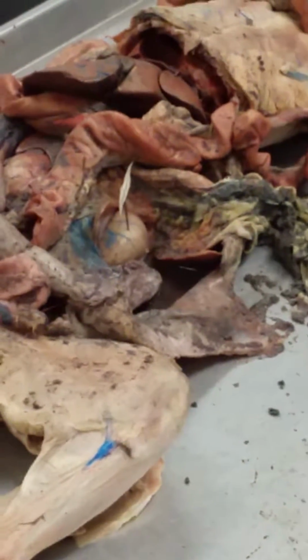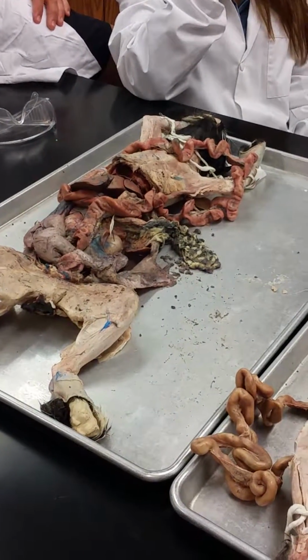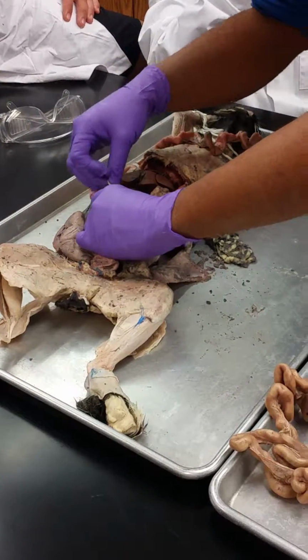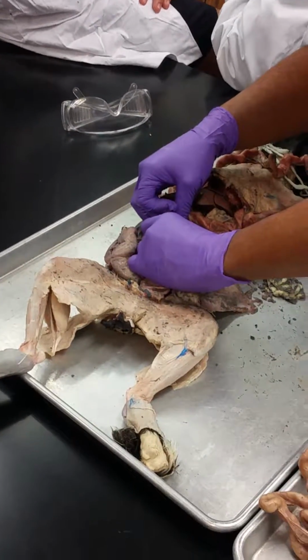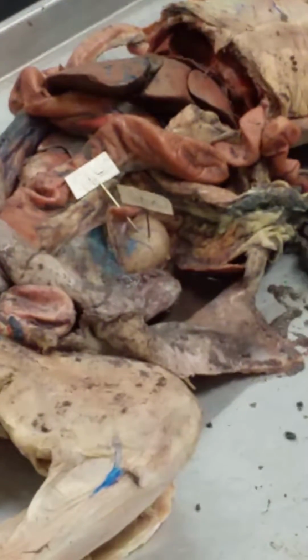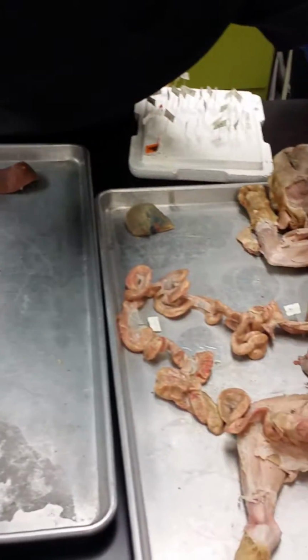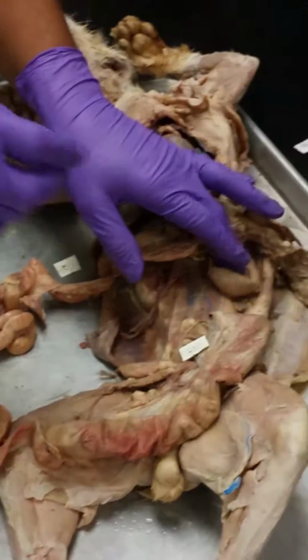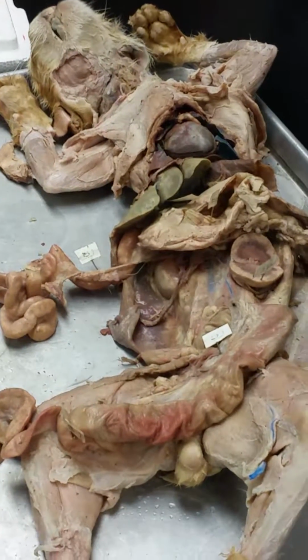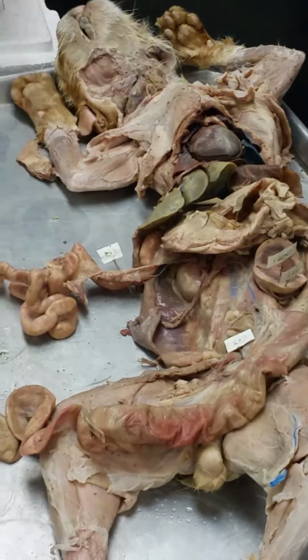Renal capsule. You had an 18. Oh, it's a better 18. Alright, we need the capsule. So that's what we peeled back right here, this layer. The renal capsule. Okay. The renal cortex. Cortex. Who else has a kidney? Okay. Fold this kidney open. So the cortex is the superficial lighter region. The renal medulla. Right. 20. We're at the renal medulla. 21. Renal pelvis. Renal pelvis.